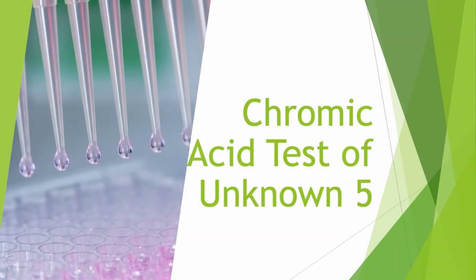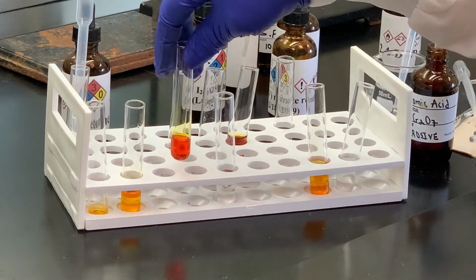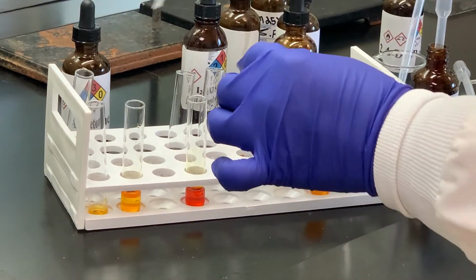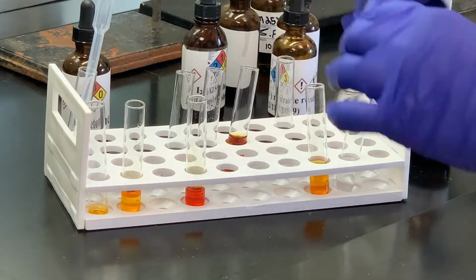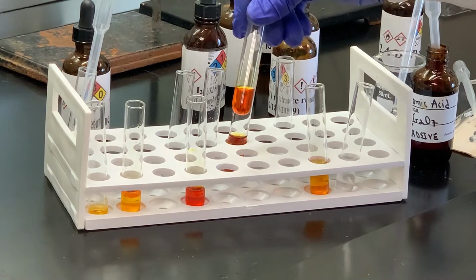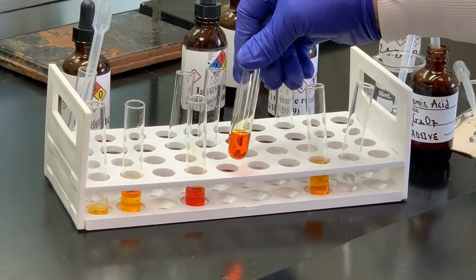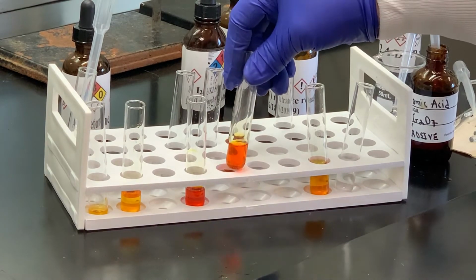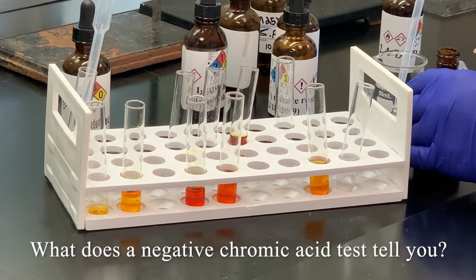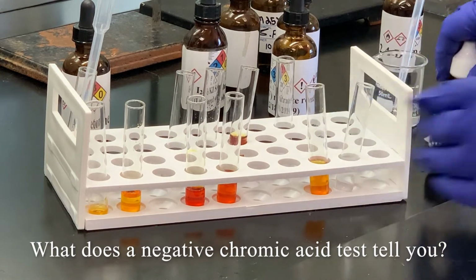Now we're going to move to our chromic acid. I've got chromic acid dissolved in acetone. That's our reference. Here's acetone. I'm going to add some of my sample to that, swirl that, and then we'll add some of our chromic acid. Notice, usually this is fairly quick, even if it takes a couple minutes for the green precipitate, you typically see some color change. I don't see any color change, so we're going to consider that negative. What does that tell you? Remember, chromic acid is an oxidizer. So something has to be susceptible to oxidation, which this substance is not. So think about those functional groups.